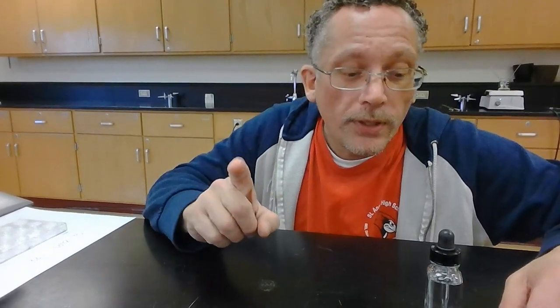All right, now let's do our experiment to determine calcium and zinc. So here, this is calcium chloride. Notice calcium is the only cation here that we're talking about that doesn't have a Roman numeral with it. Remember, Roman numerals go with the transition metals, and some of the post-transition metals, when they can have multiple different charges. But calcium is not a transition metal. Calcium is an alkaline earth metal, so we know its charge has to be positive 2. So we don't need to include a Roman numeral to say what its charge is.